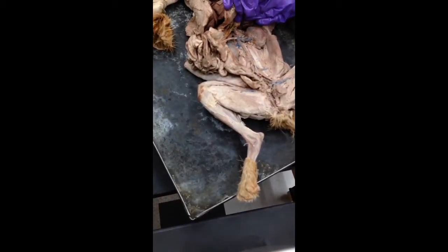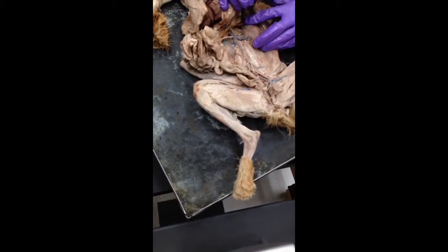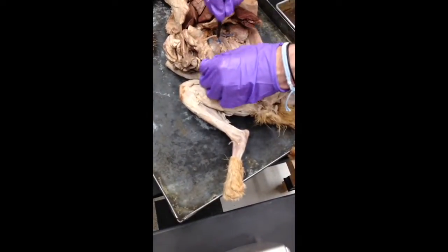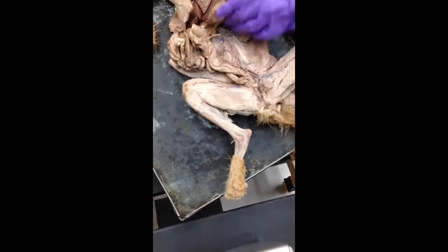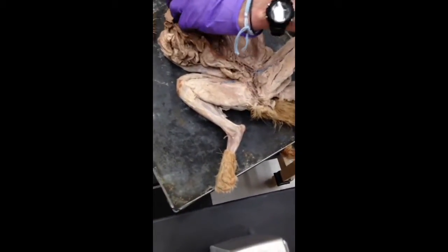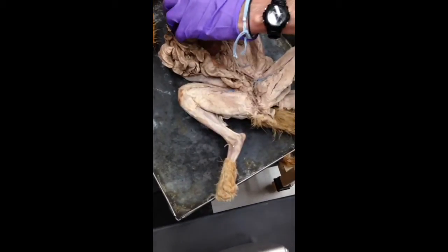So, renal vein. And you see the red thing? What are those going to be? Arteries? Yes. That's simple. You just have to know the names of stuff. Technically, there's other stuff in there, but I'd really have to take out chunks of the liver to get at those.